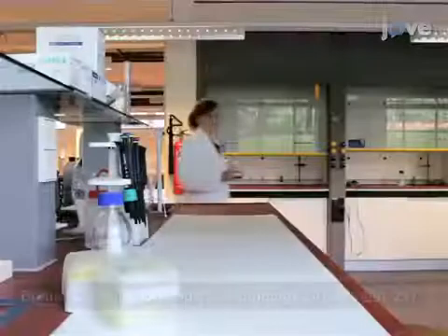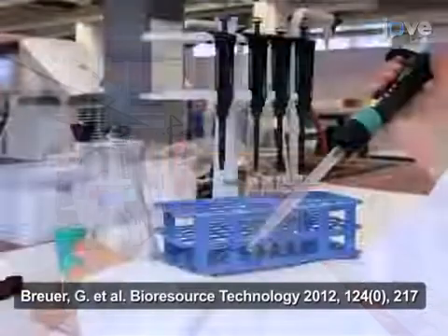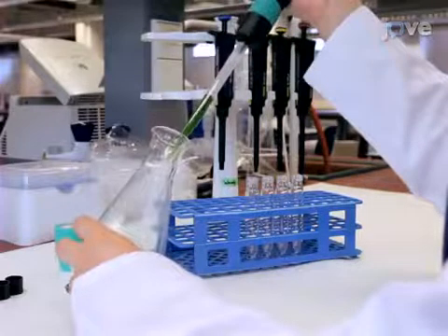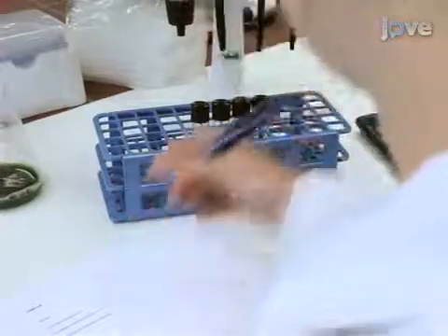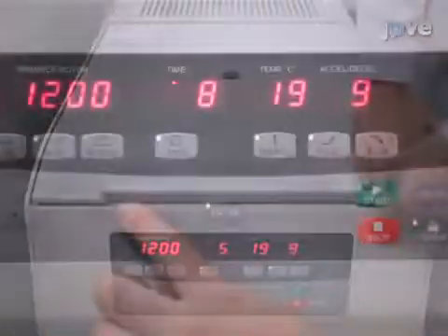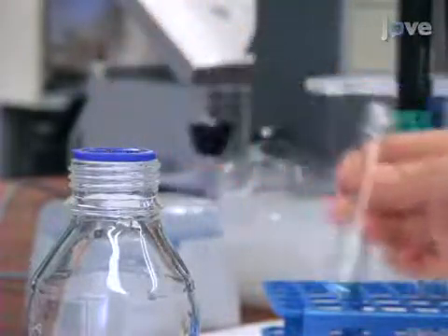Before starting this procedure, determine the algae dry weight concentration in grams per liter in the culture broth as detailed in the listed reference. Transfer a volume of culture broth that contains 5 to 10 milligrams of algae dry weight to a glass centrifuge tube. Calculate the exact amount of biomass transferred using the biomass concentration determined previously. Centrifuge the sample for 5 minutes at 1200 g's, then discard part of the supernatant, leaving approximately 0.25 milliliters in the tube.